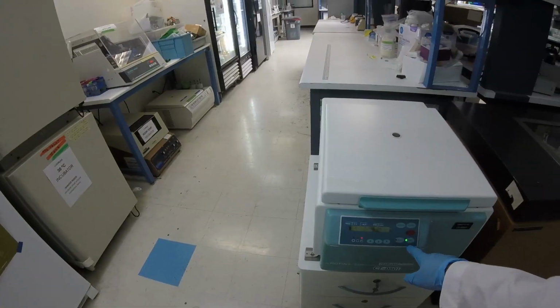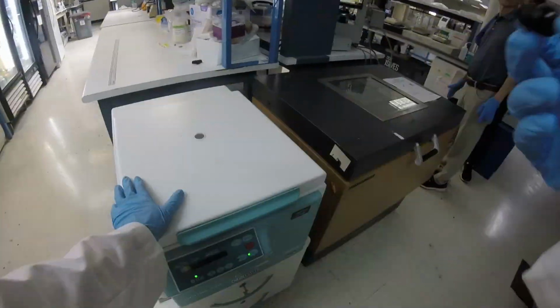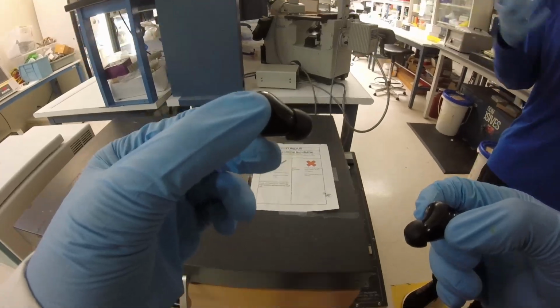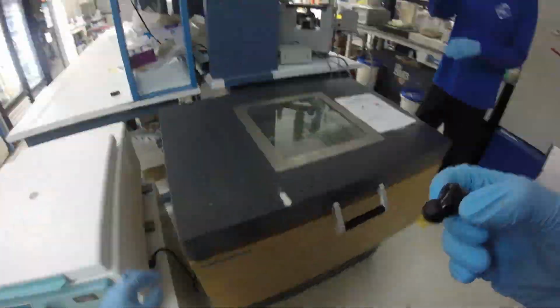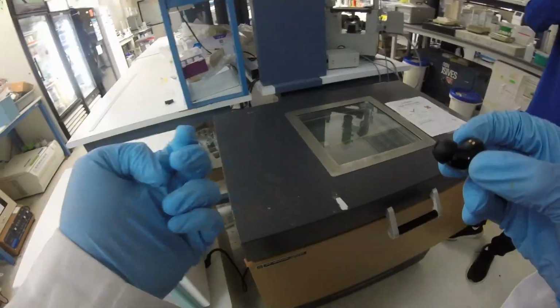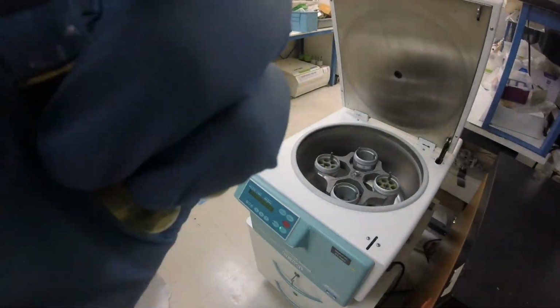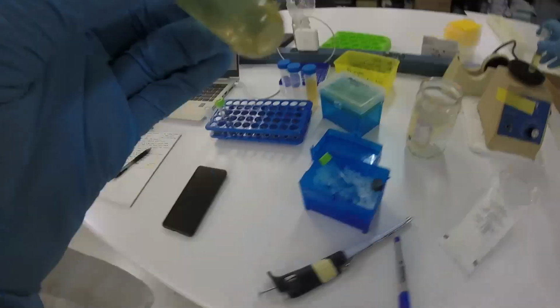The other thing that I did is I just made a 50% glycerol stock because, on top of this freezing point and nucleation site thing, it's also helpful in the process of preparing the cells for electroporation. One, glycerol is apparently membrane permeable, so it can get into the cells. And because of that, it reduces the osmotic stress of the procedure of making them ready for electroporation, which is called making the cells competent or electrocompetent.